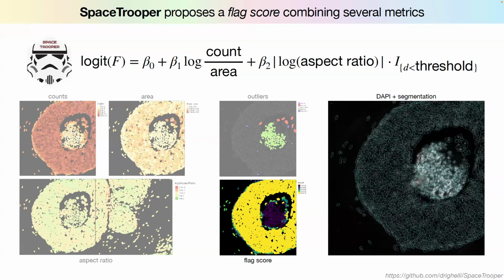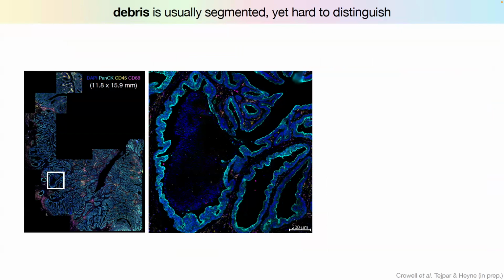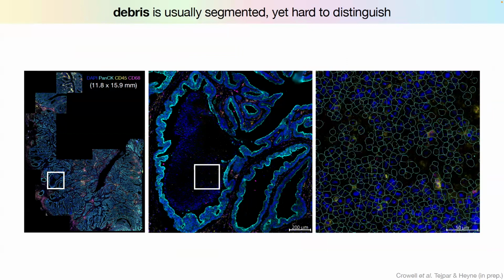And sorry, just to convince you that I was happy when I saw this talk from that guy because I had a data set that had exactly this. This is a cancer section. And there's this bubble down here that was annoying us because we didn't know what it was. This is, again, the bubble. And out here is like epithelia. And in here, there's DAPI, but they're not cells. We really don't know what they are. And the problem is that the segmentation thinks they're cells. So the segmentation sees the DAPI and it segments a bunch of cells. What we think now is that this is debris that the tumor is flushing out, or it's like dead cells, or it's not clear, but it's debris that is being segmented.